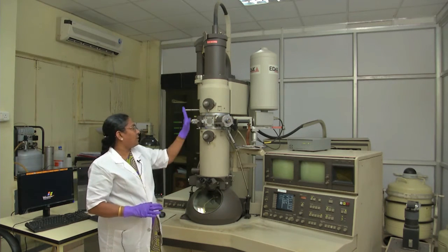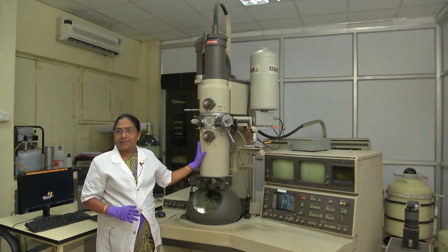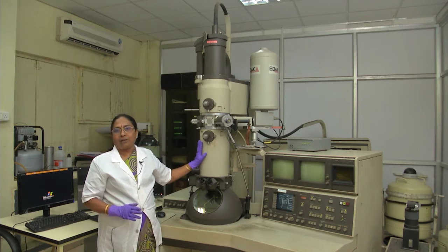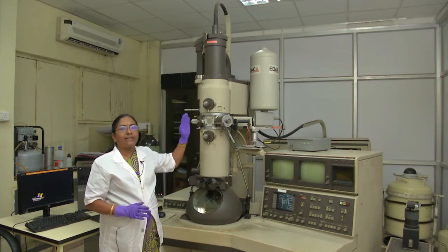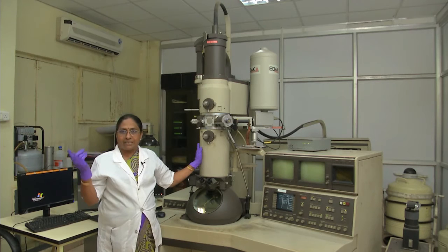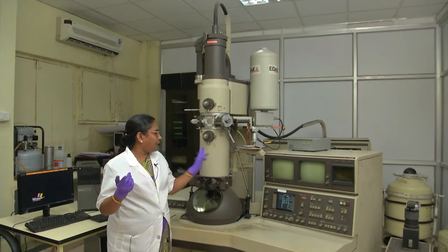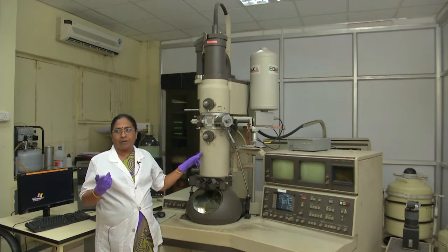Because we are using electromagnetic lenses, the whole instrument gets heated up. To avoid overheating, it is circulated with 20°C chilled water using a chiller. Also, the whole system is under high vacuum.